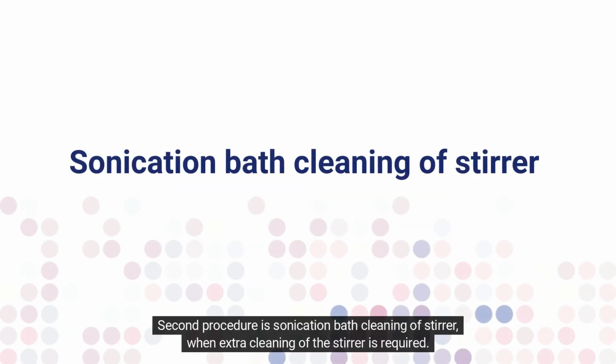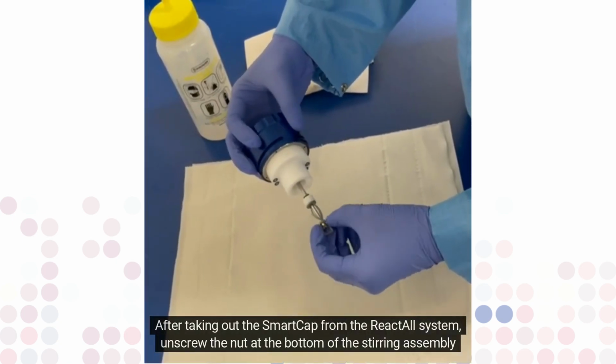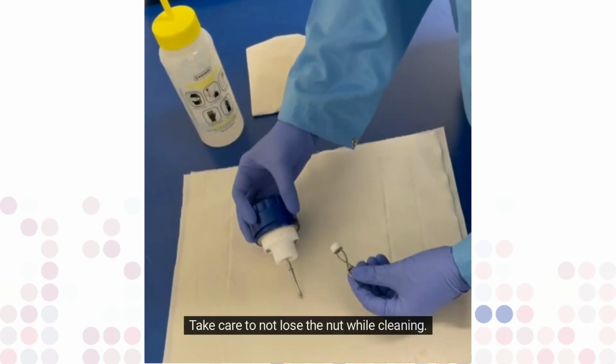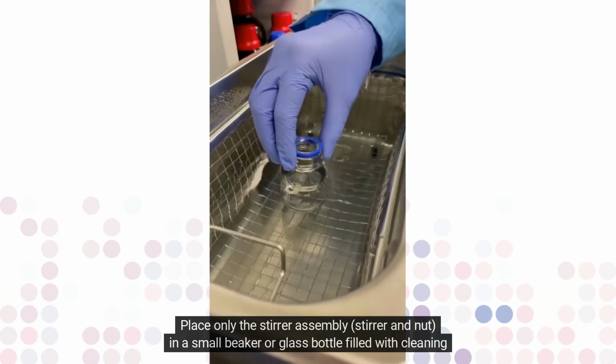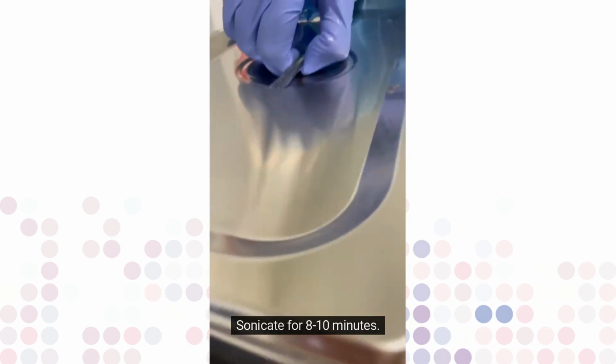Second procedure is Sonication bath cleaning of stirrer, when extra cleaning of the stirrer is required. After taking out the SmartCap from the ReactALL system, unscrew the nut at the bottom of the stirring assembly while keeping the sample tube attached. Take care to not lose the nut while cleaning. Place only the stirrer assembly, stirrer and nut in a small beaker or glass bottle filled with cleaning solvent. Sonicate for 8 to 10 minutes.